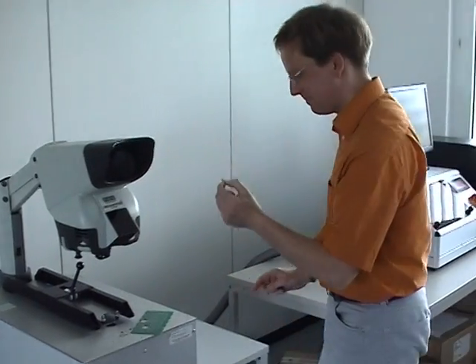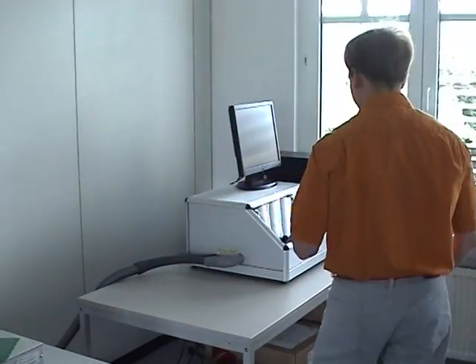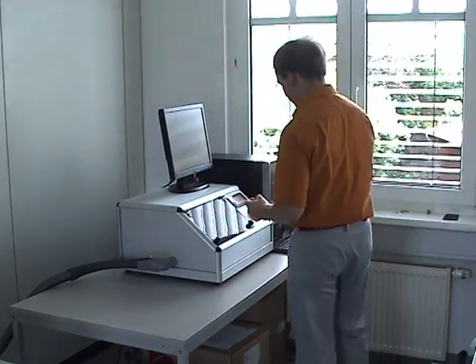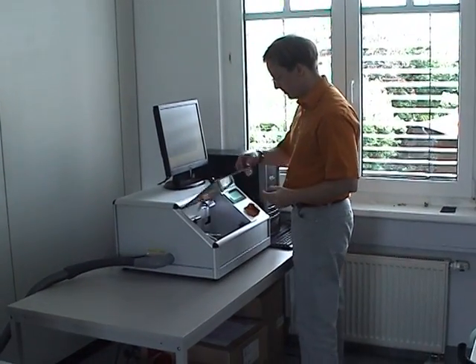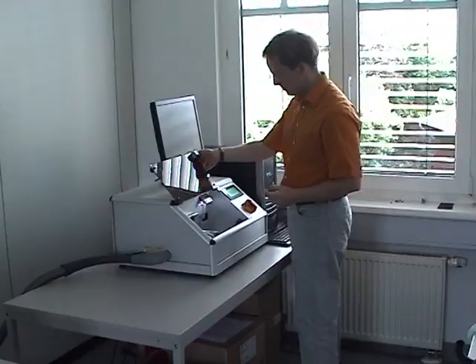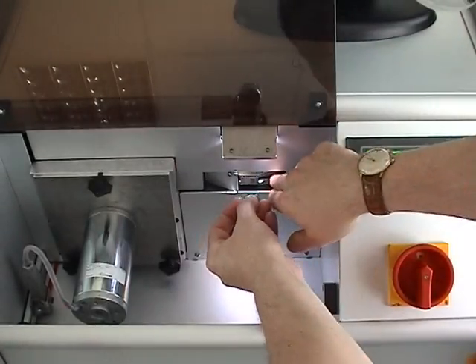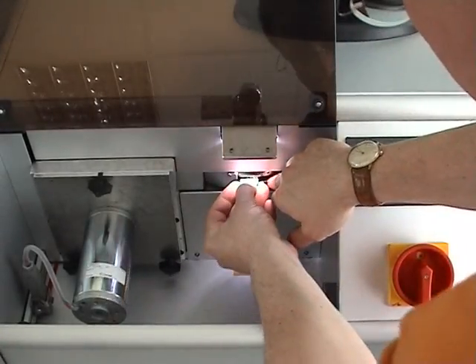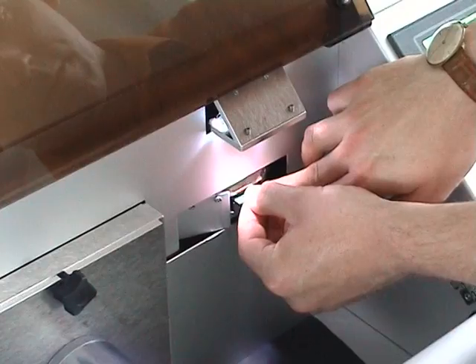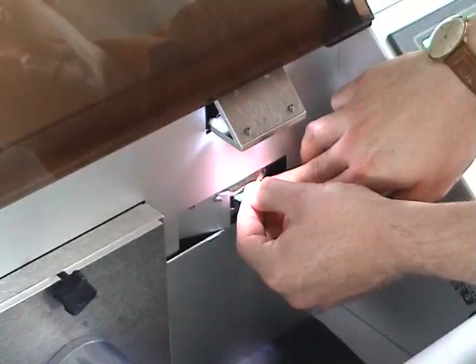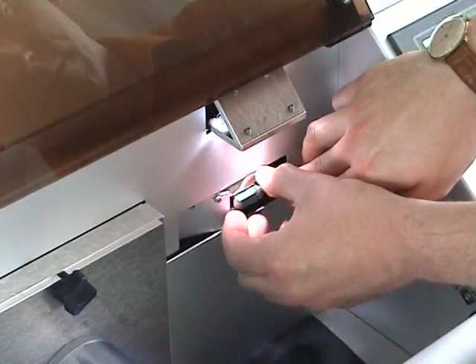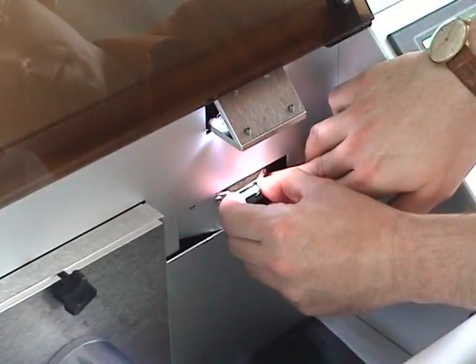In the next step, the specimen will be processed further in the electrical sawing machine called TSM. The specimen gets clamped in a pneumatic clamp system.